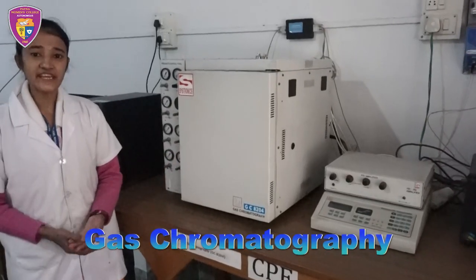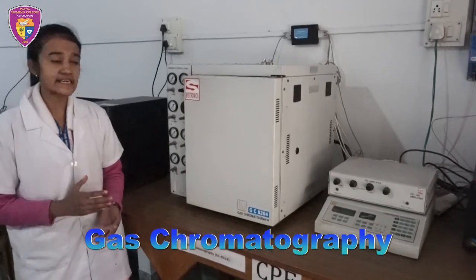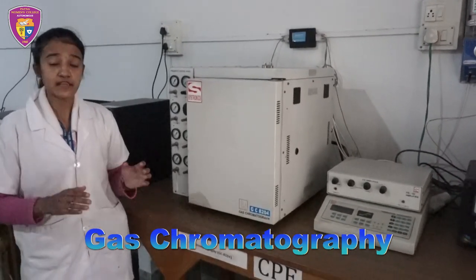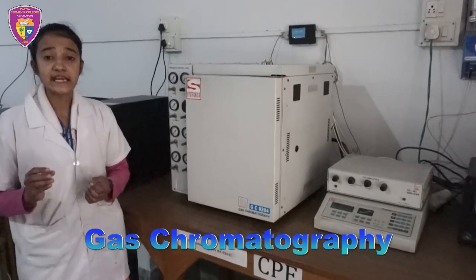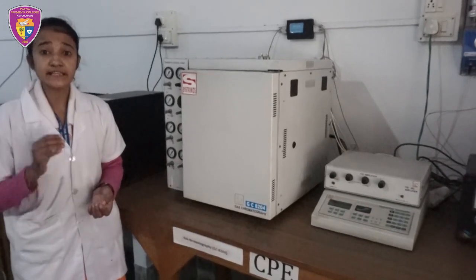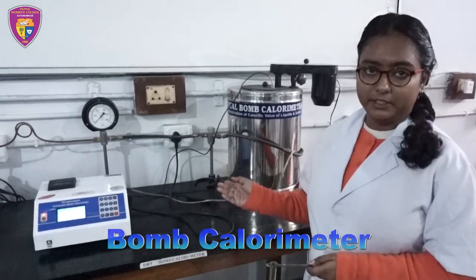This is gas chromatography. It is based on the principle that when a sample is inserted in the instrument, it enters the gas stream which transports the solution into a separation tube known as a column, where the various components are separated. The typical use of gas chromatography includes testing the purity of a substance or separating the various components of a mixture.